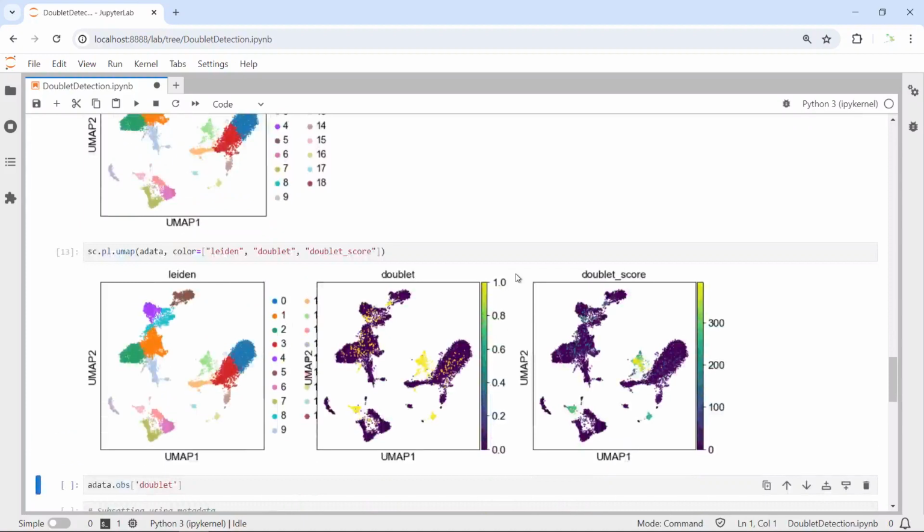You can see here, left-hand side is the Leiden clusters. Then the middle UMap will show the doublet. You can see all the doublets were indicated by yellow color. Singlets were labeled as dark blue color. And on the right hand side, you can see the doublet score. You can see those cell clusters, they have a high doublet score and they are labeled as doublet. So from the UMap, you can clearly see 3 cell clusters. They are doublets.